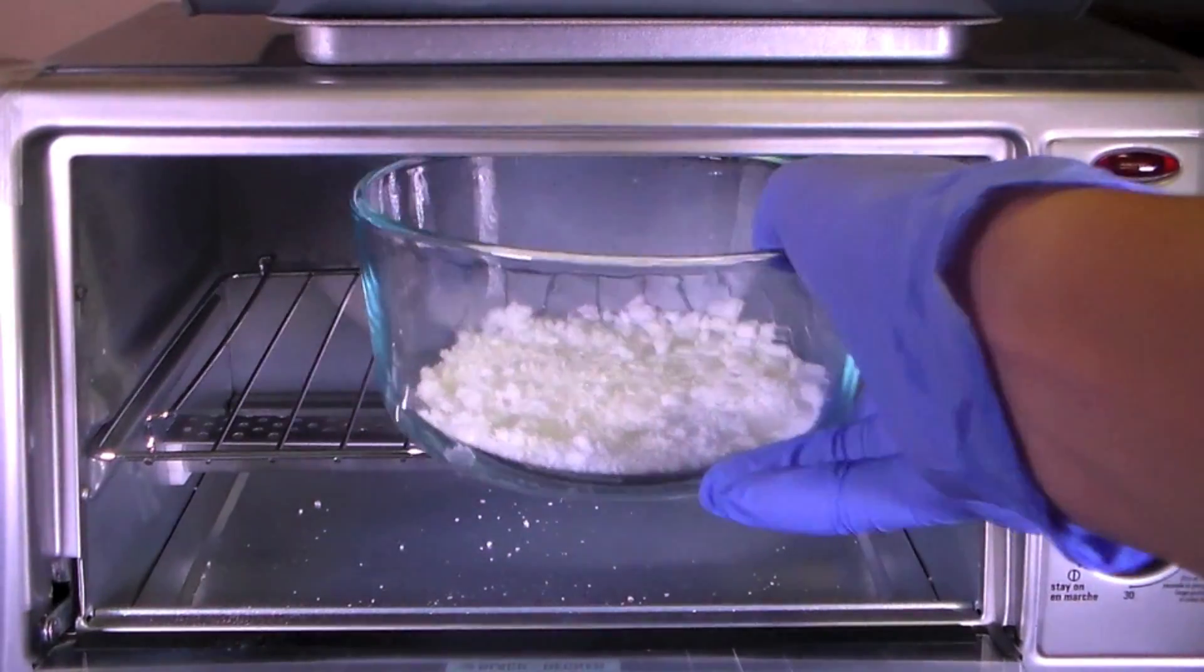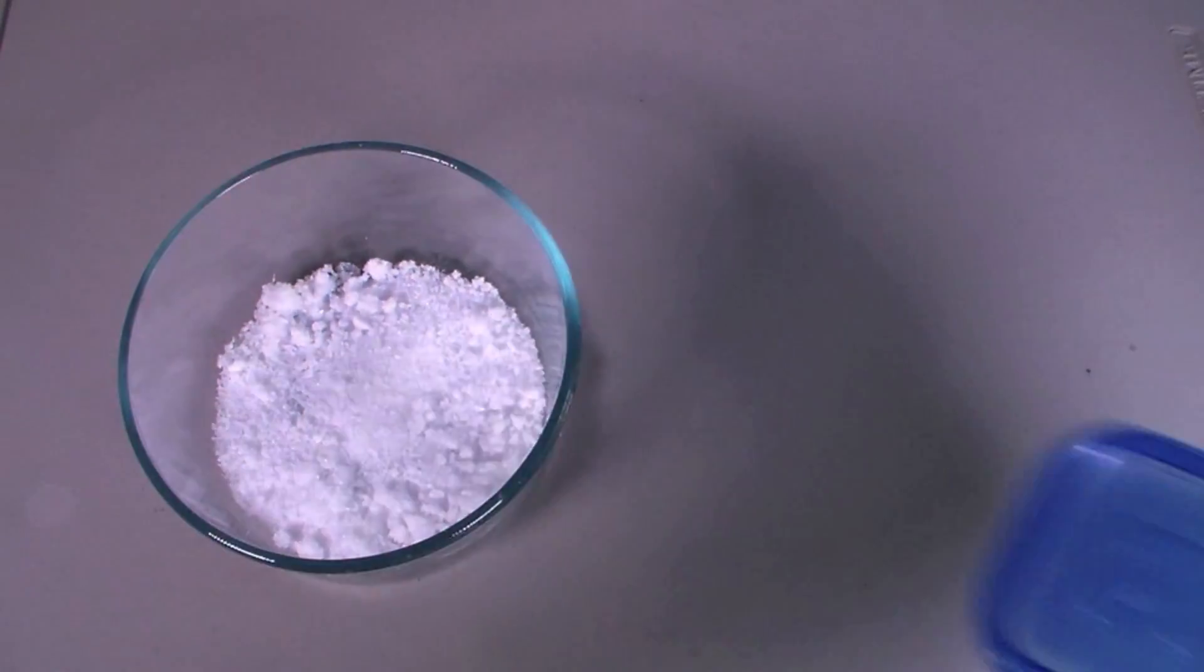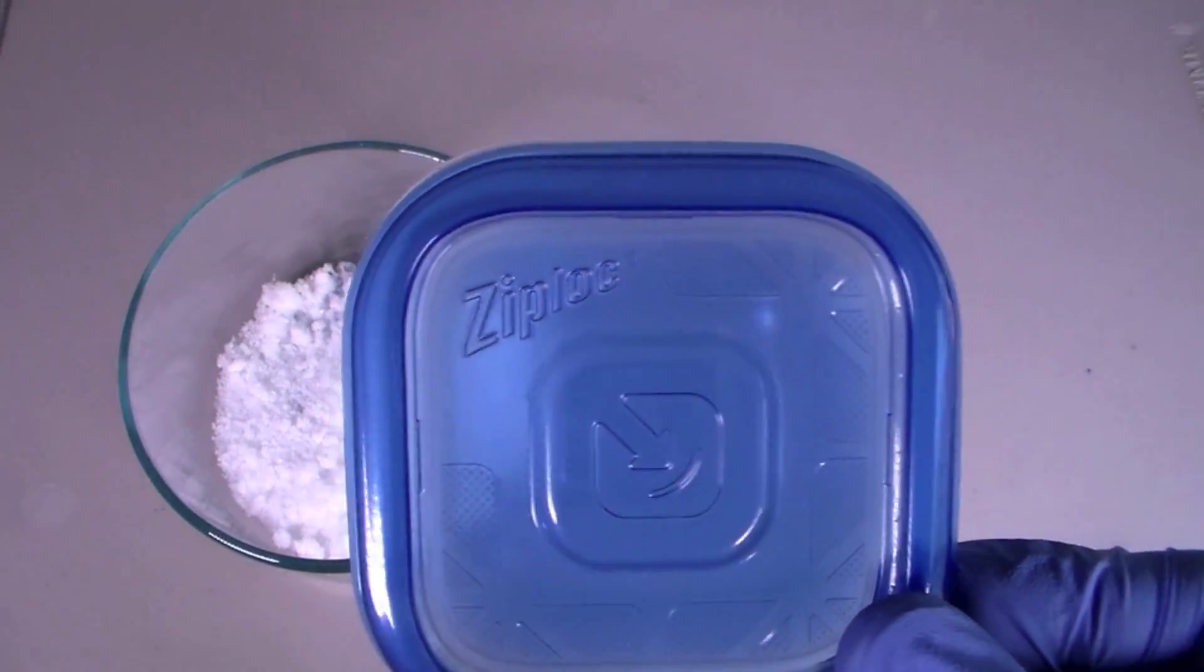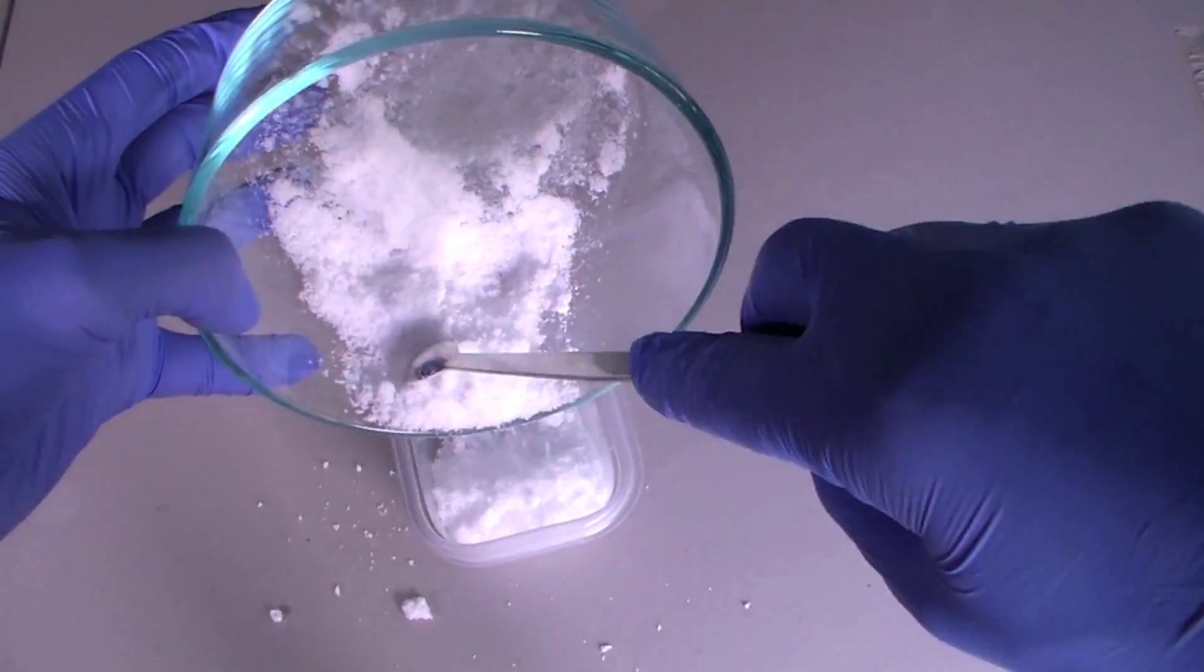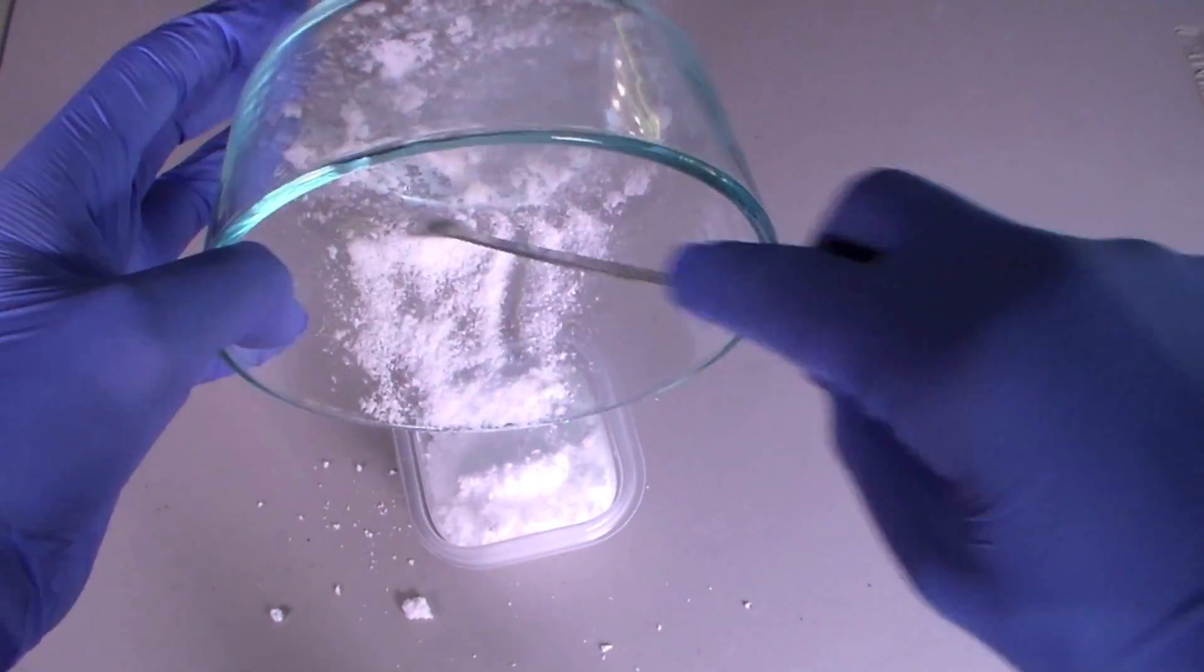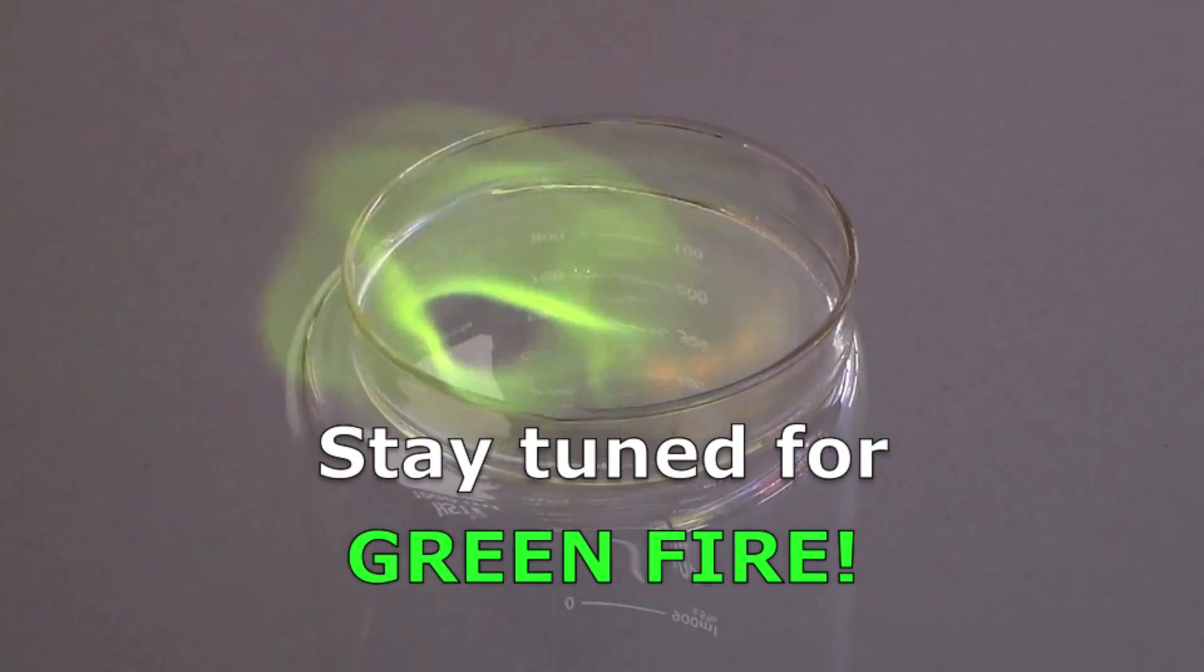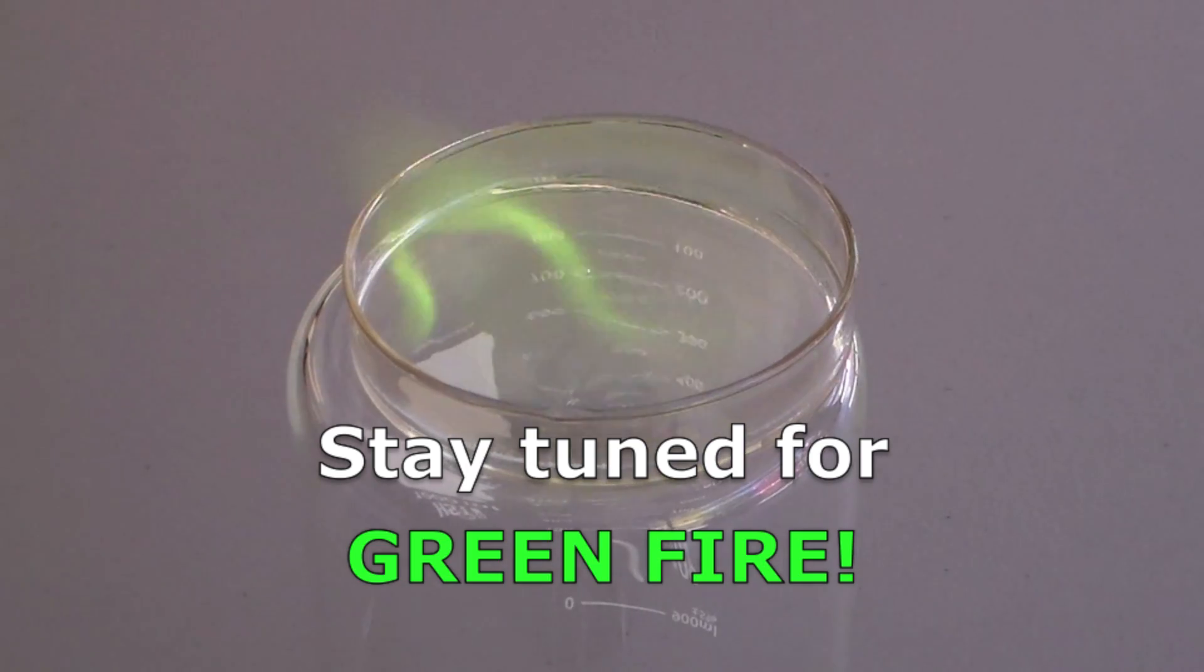After drying, the product was removed from the oven and transferred into a very high-tech scientific storage device. In an upcoming video, I will be using this boric acid to make green-colored flames, so stay tuned for that experiment.